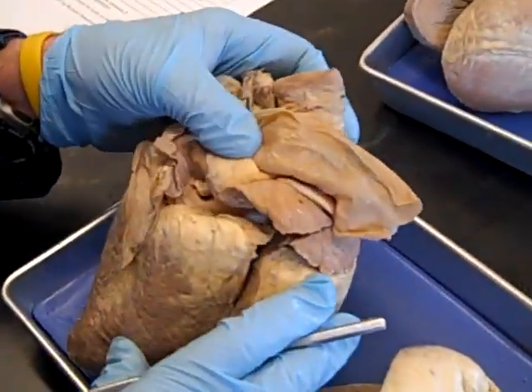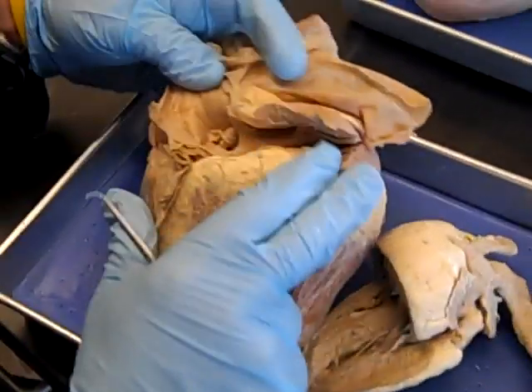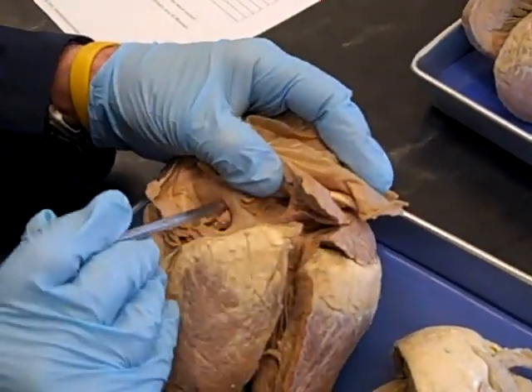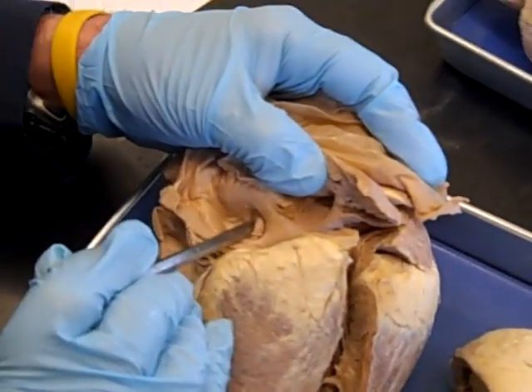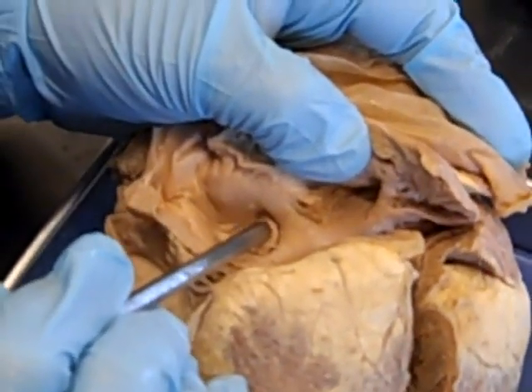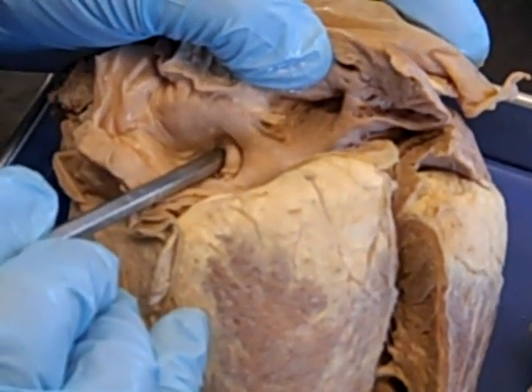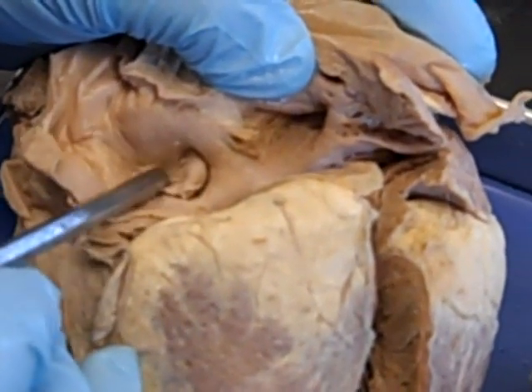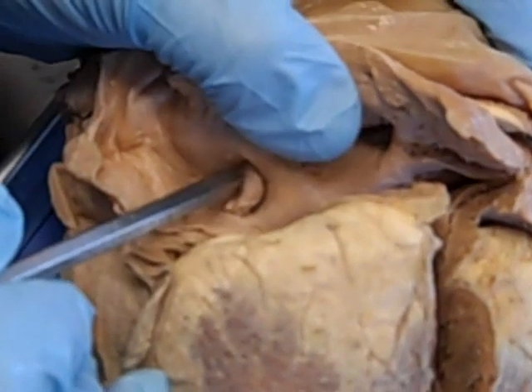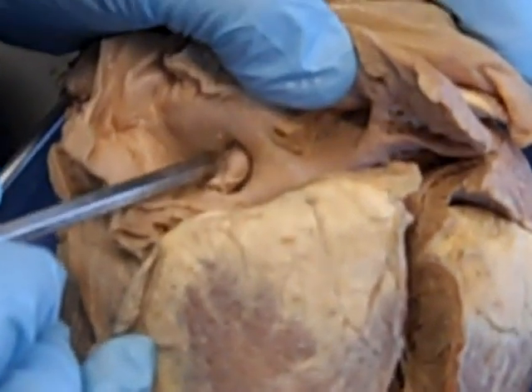One of the things I talked about was the right atrium in the first video. This heart has been cut through the wall of the right atrium, and if we pull it back, you can see that there is a depression right here about the size of the end of your finger. That is the fossa ovalis. It's oval-shaped, and it's a depression between the right atrium and the left atrium. It's in the interatrial septum.